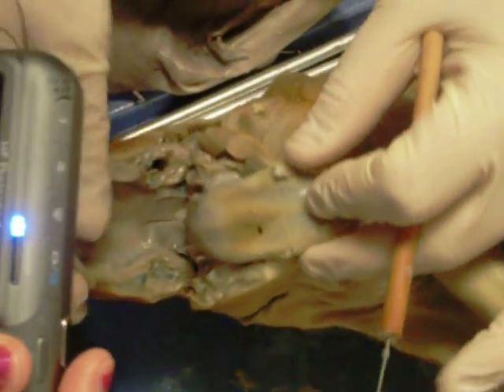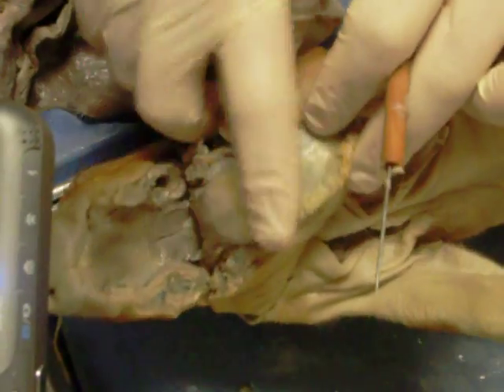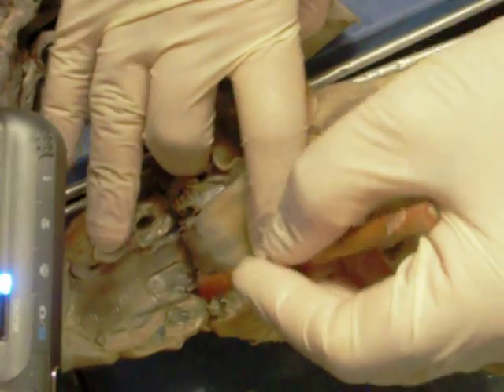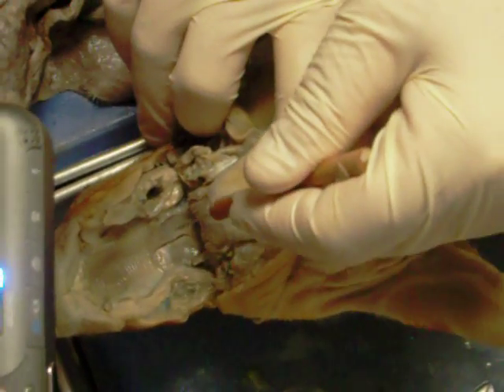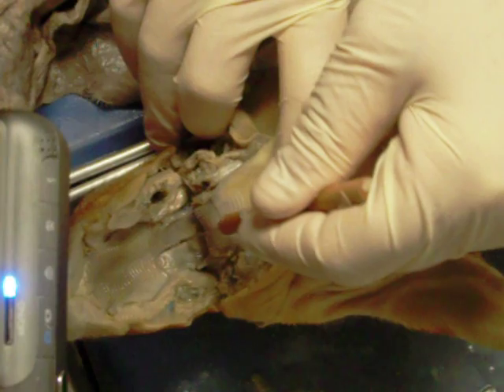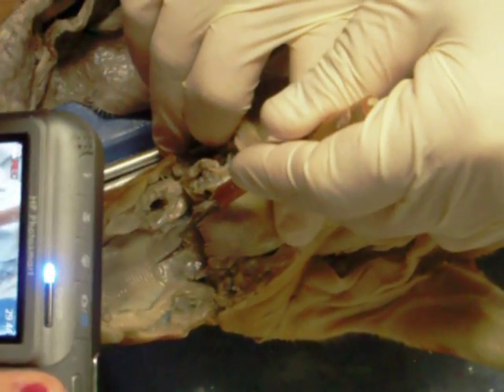There's the tongue with the fungiform papilla. Here we have the hard palate and the soft palate. The soft palate has been cut to expose the nasopharynx.